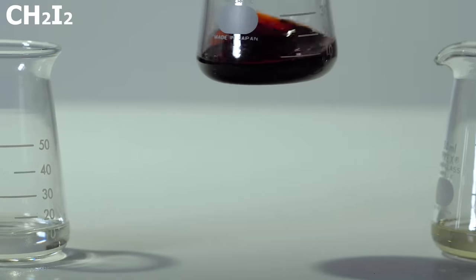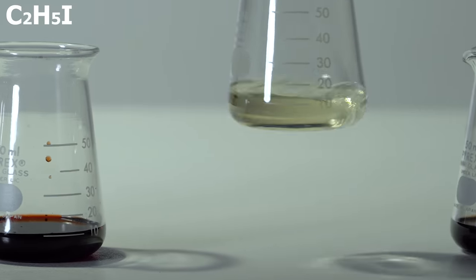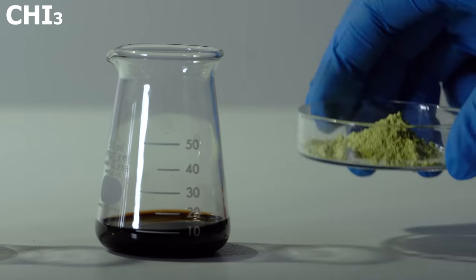For this experiment I used methyl iodide, methylene iodide, ethyl iodide, allyl iodide and iodoform.